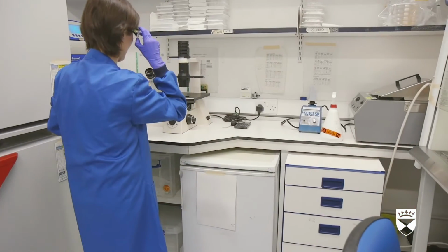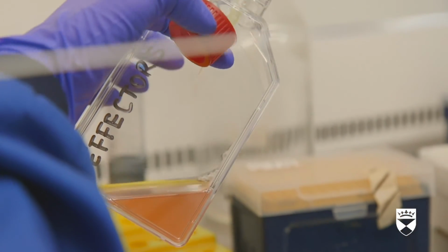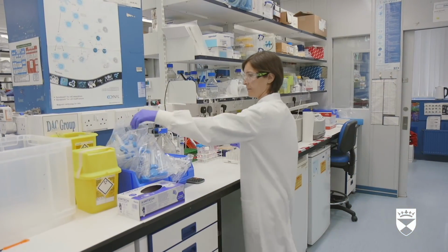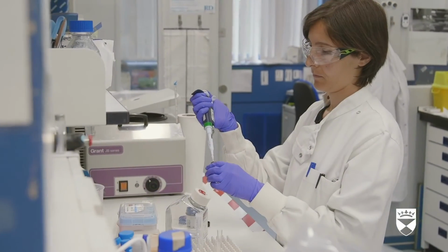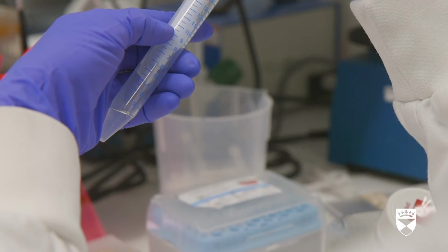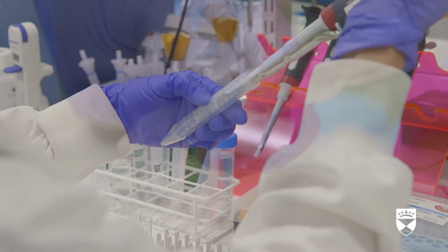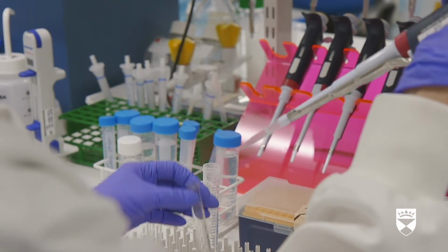She injects a clear liquid into a 15 milliliter tube before adding it to the first tube. We prepare a sample for counting by adding 100 microliters of our liquid media to a tube. We go to the bench and add 900 microliters of PBS containing DAPI to the T cells. DAPI is a fluorescent DNA stain that only stains dead cells. We count the T cells on a machine called a flow cytometer. It can count up to 10,000 cells per second.